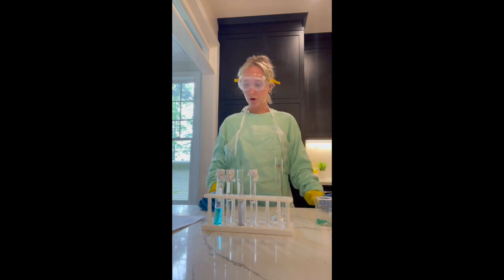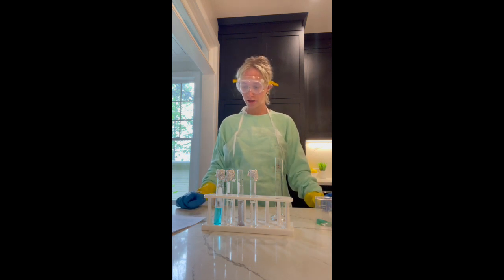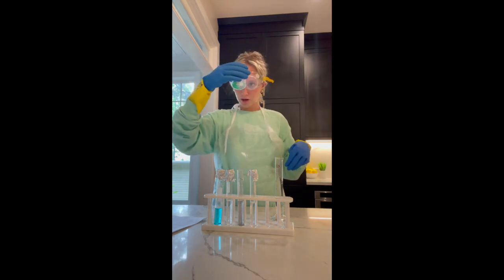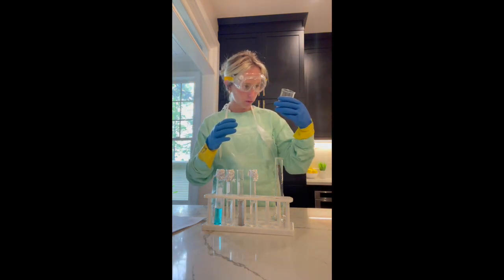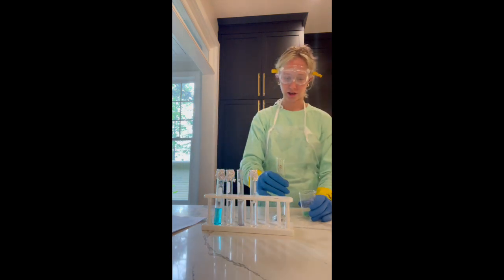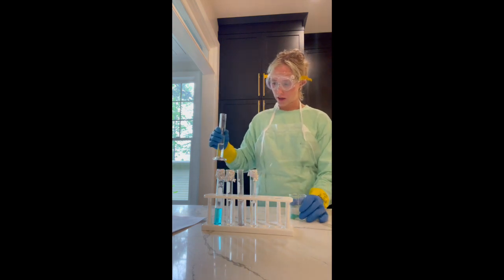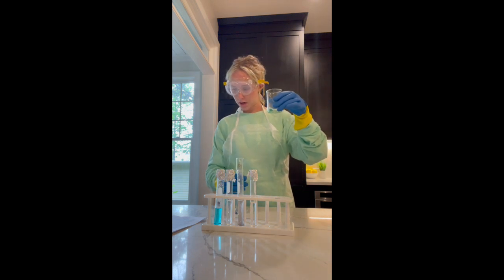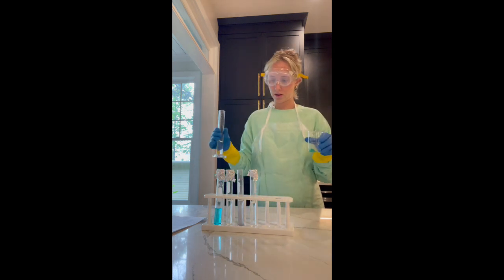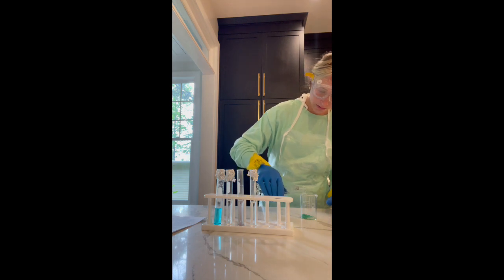Okay, so here we are on reaction 4, which is aluminum foil with cupric chloride. So right here I have my cupric chloride, which is a teal, solid, almost powdery substance, and then I have my clear distilled water, which is obviously liquid. I have my 3 grams in here, and my 20 milliliters of distilled water, which I pre-measured both, again, for time's sake. And I'm going to add my distilled water in.